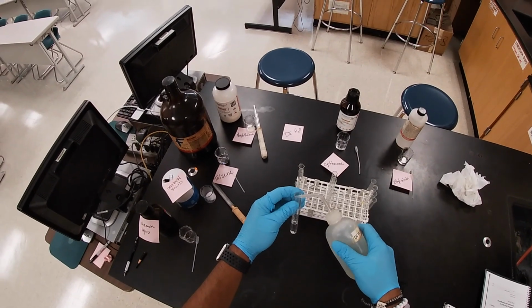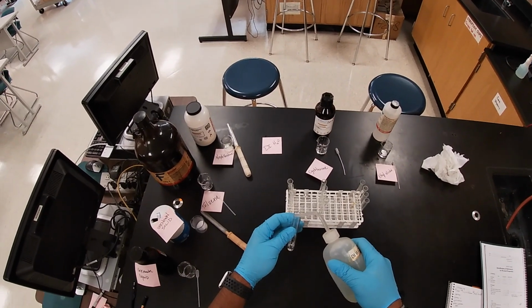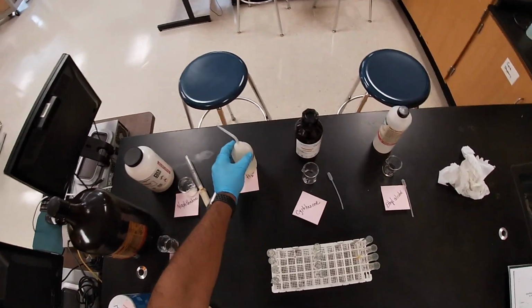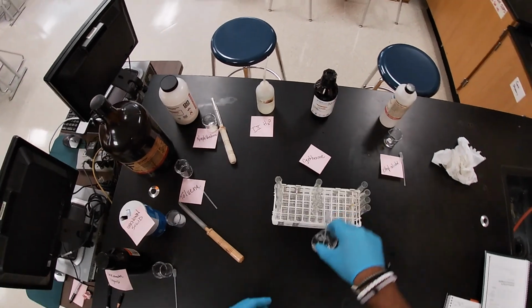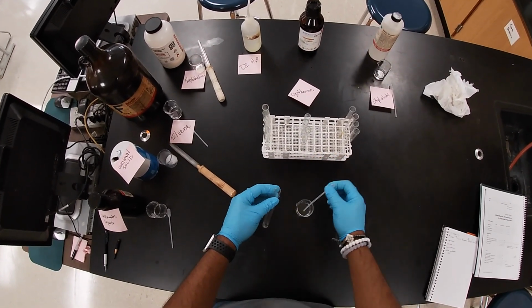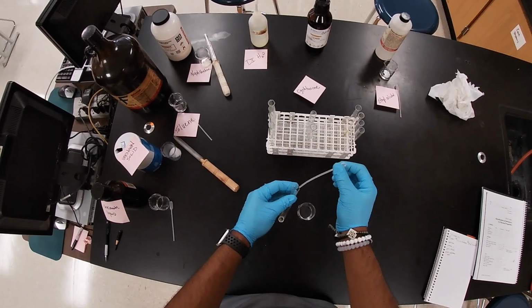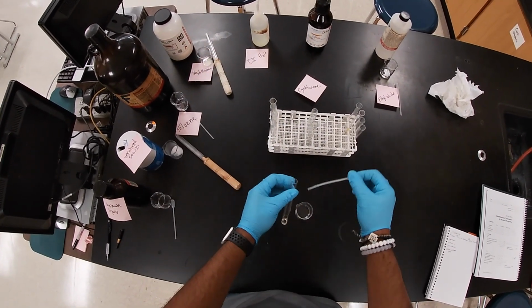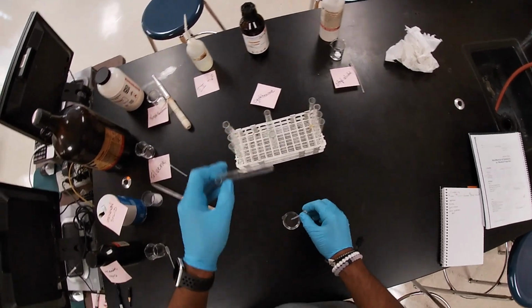So this is a qualitative analysis. This analysis is just based on observations. We're not going to record any measurements. And so we're just going to determine whether it dissolves in that solvent per se. So we got our water going on. And so now I'm going to add my cyclohexane to all of my middle test tubes. That'll be the solvent. So we got a few here. Okay, so we got one. Let's get the second one.